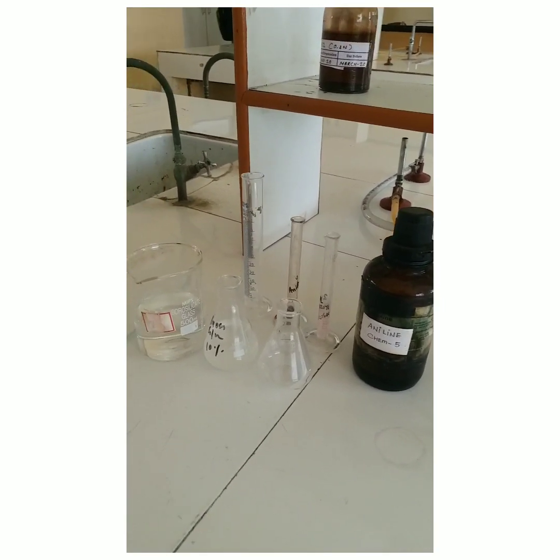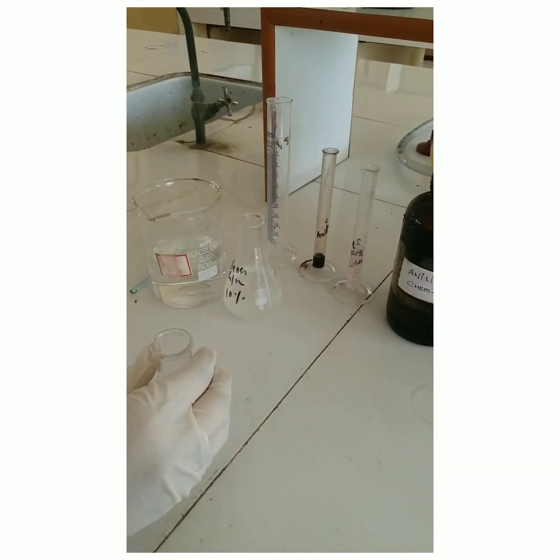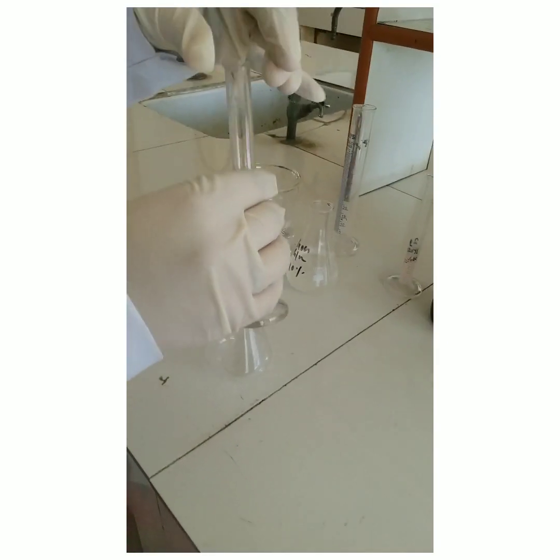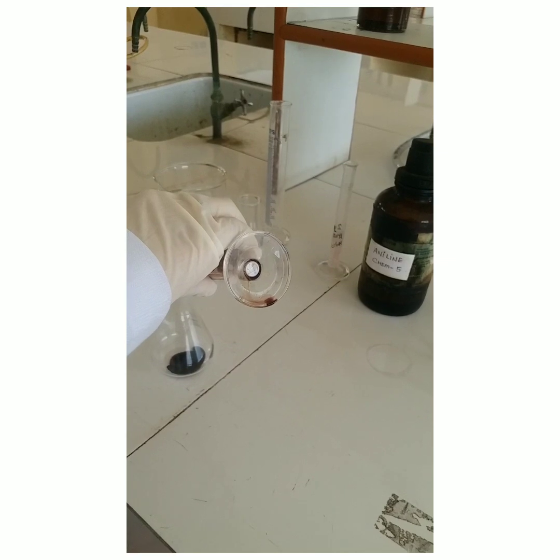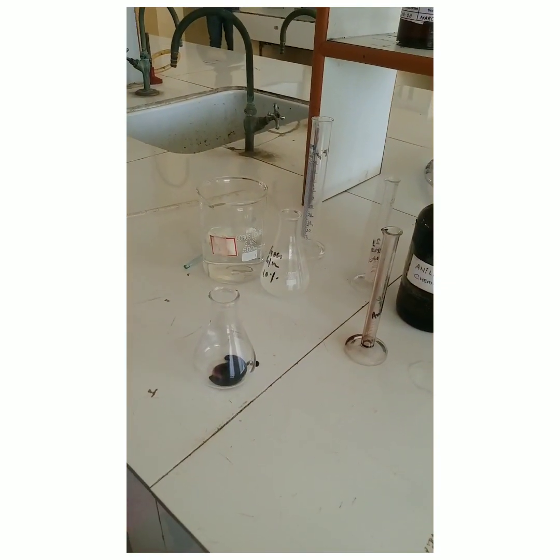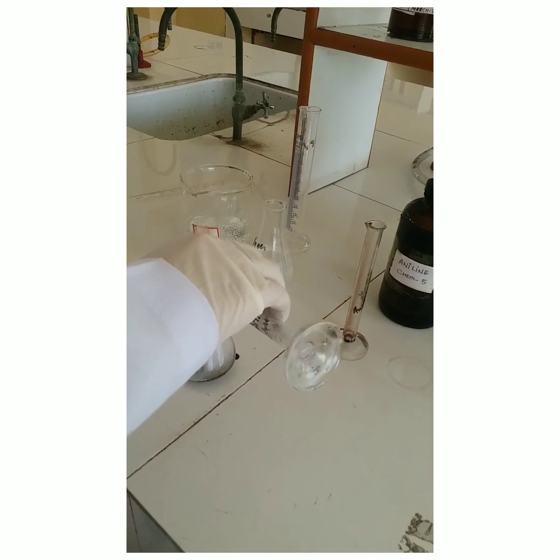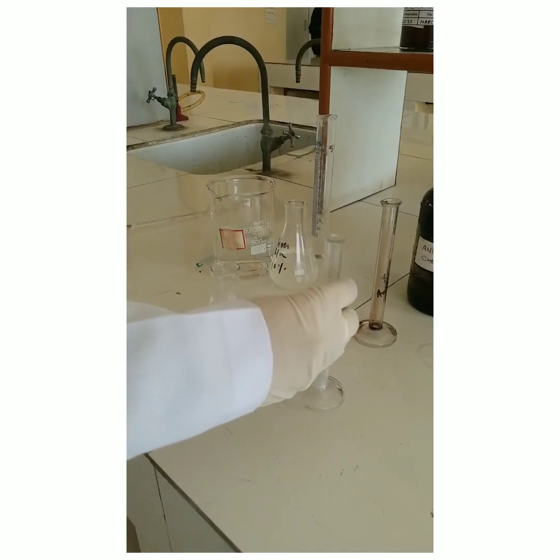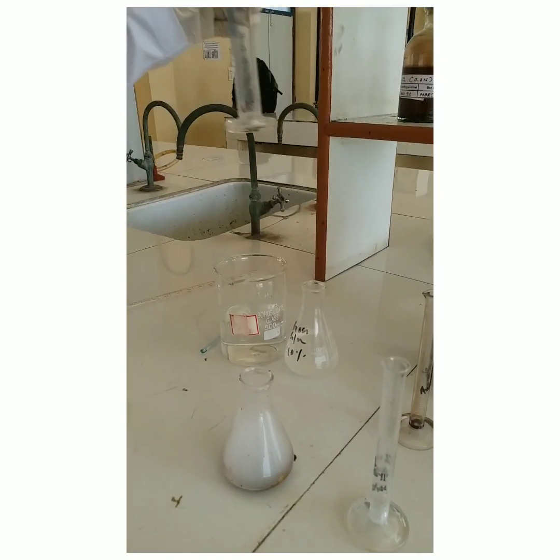Let's start our reaction. First, we have to take a conical flask and 1 ml of aniline is taken in the conical flask. Then, adding 5 ml of benzoyl chloride and 15 ml of 10% NaOH solution.